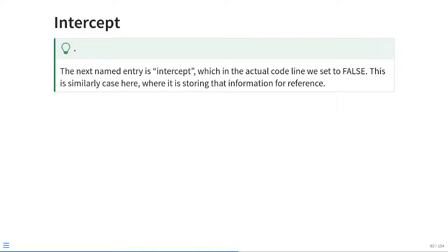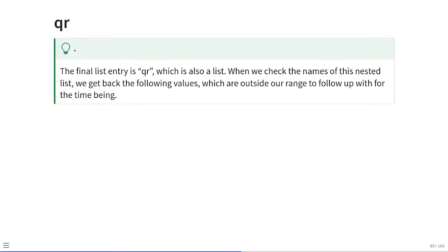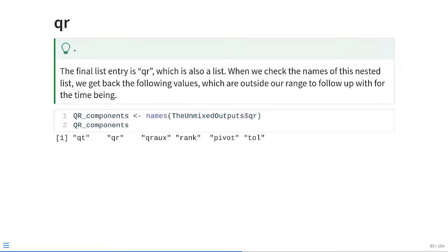The intercept was one of our arguments we specified within the line of code that we ran. As you can see, it's set to FALSE. Similarly, if we check what's present in that named list output, you can see it's also showing up as FALSE, so it's just being stored as a reference. And then same kind of story for QR. QR is also a list, so if you check the names of the items within QR, you can see we got qt, qr, and a few others. These are more on the minutia side as far as what this function does, so we're not going to walk through these today, but they're there for anybody who would be interested in them.